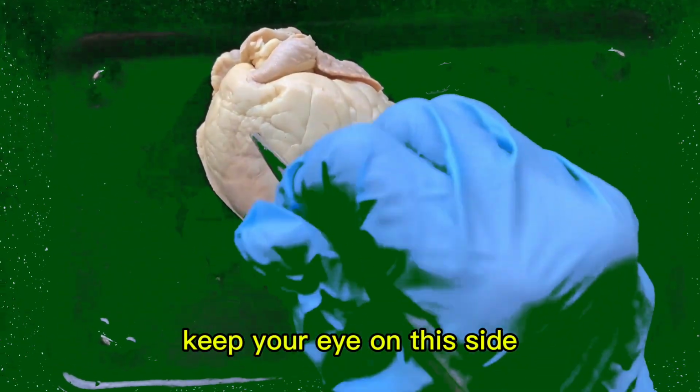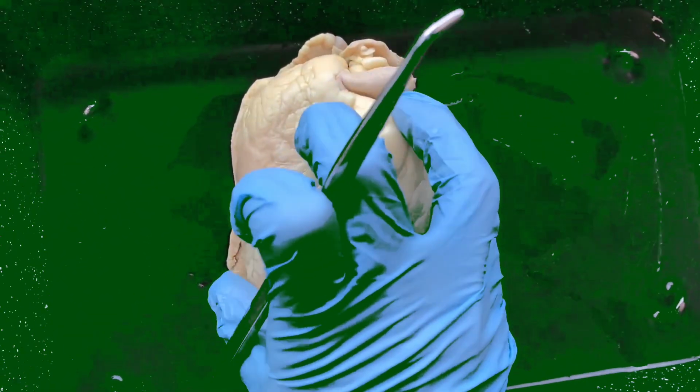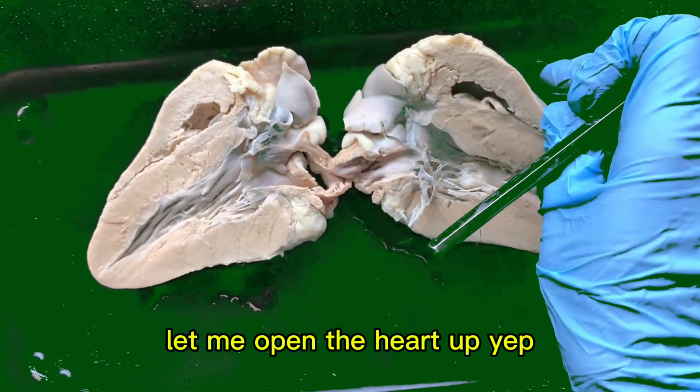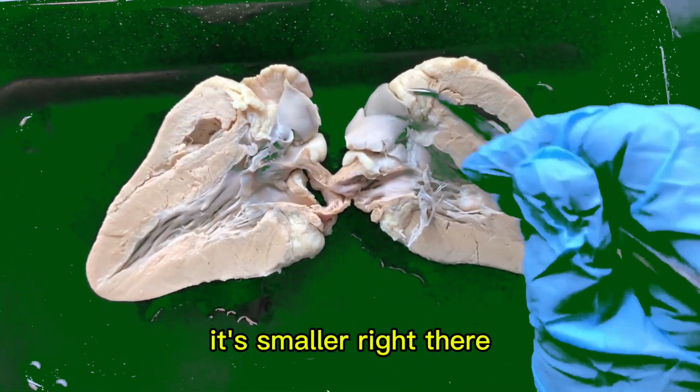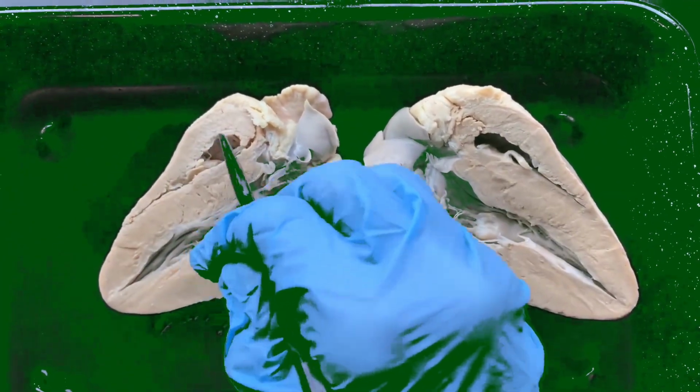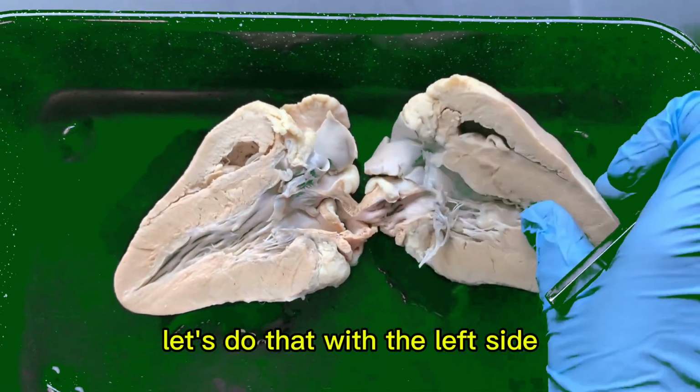Keep your eye on this side and let me open the heart. Oh, yep, it's smaller right there and right there. So that is the right ventricle. Let's do that with the left side.